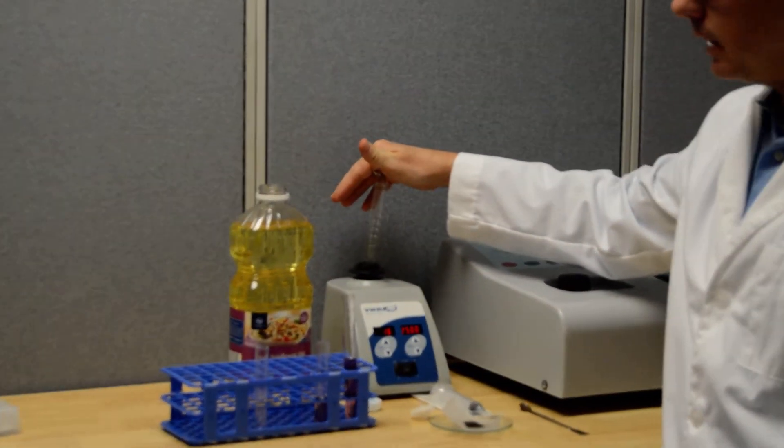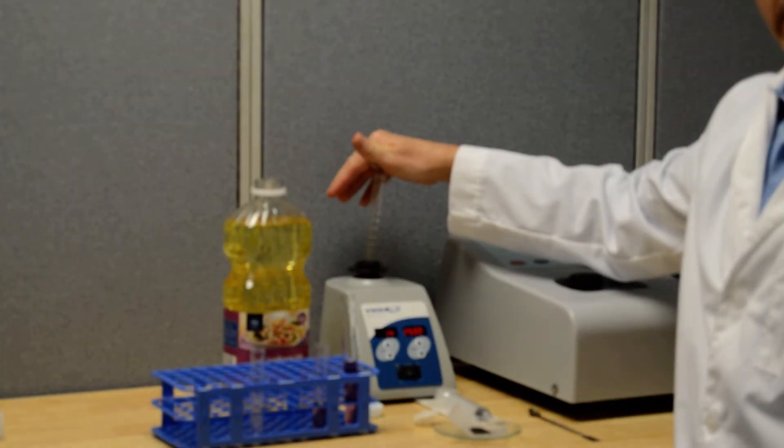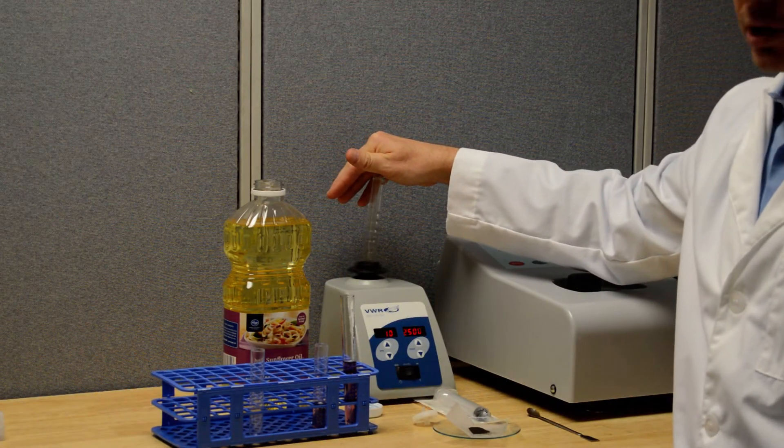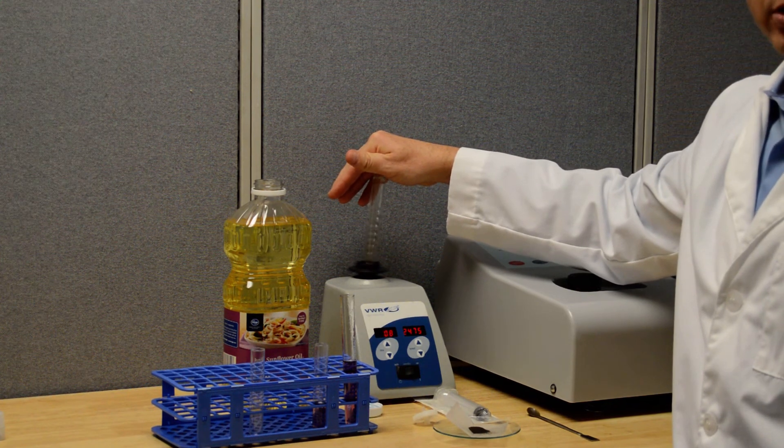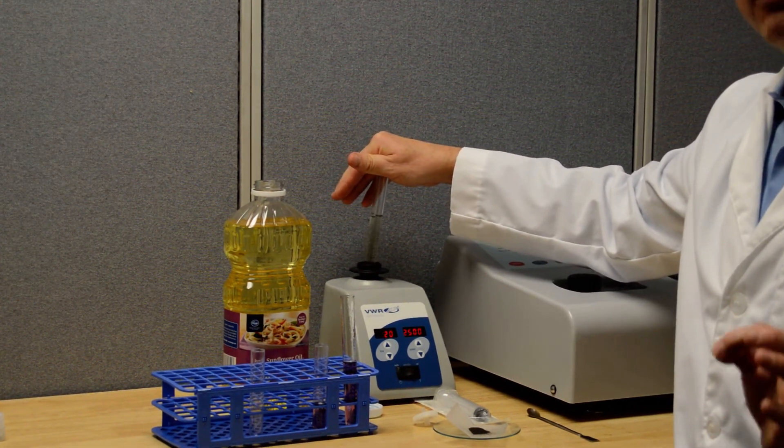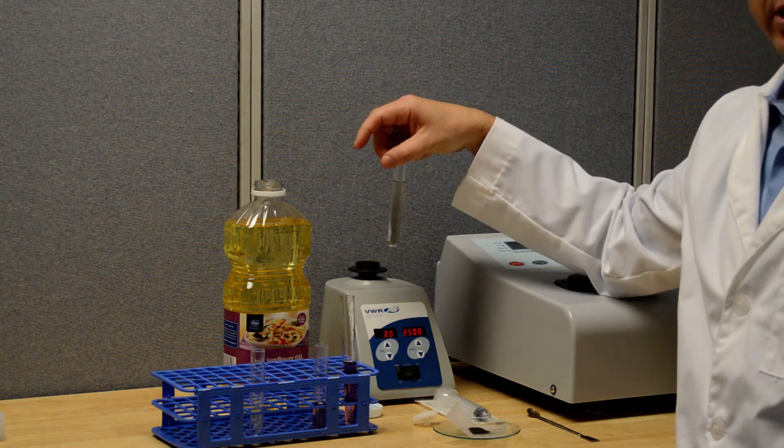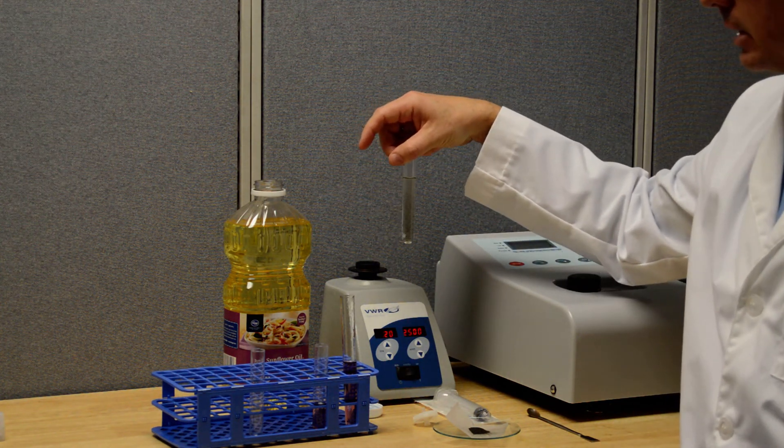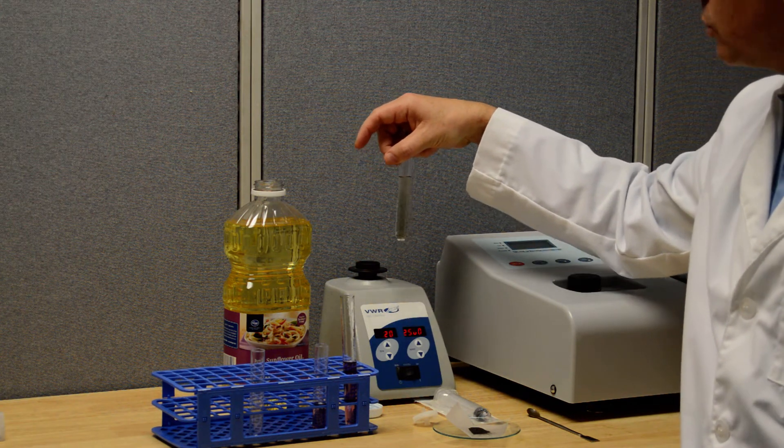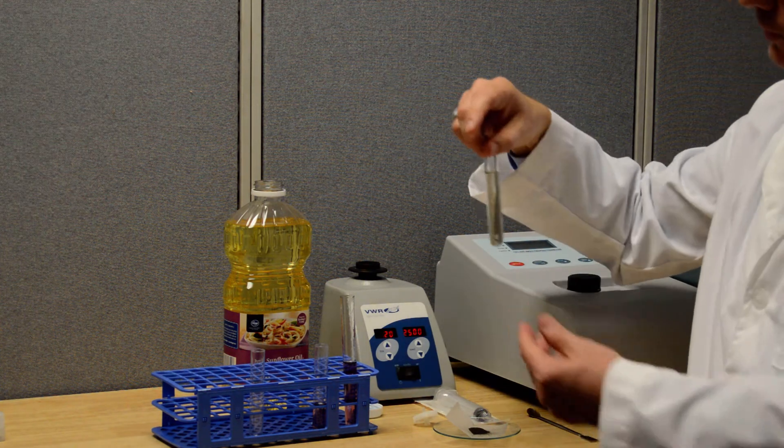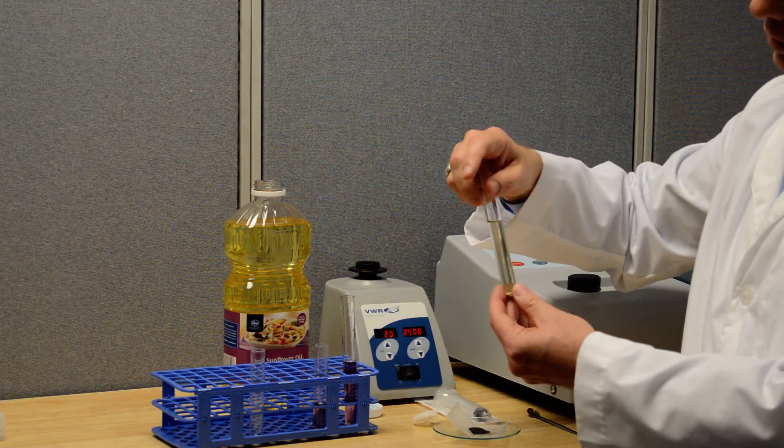It's a way to mix rapidly that doesn't use sonication so it's really important to not use sonication in this process. The reason is when you use sonication you get very local, very high temperatures throughout the mixture and those high temperatures can actually degrade the oil and degrade the C-60 and how it interacts with the oil. So you definitely do not want to sonicate your C-60 olive oil or whatever oil you're working with.